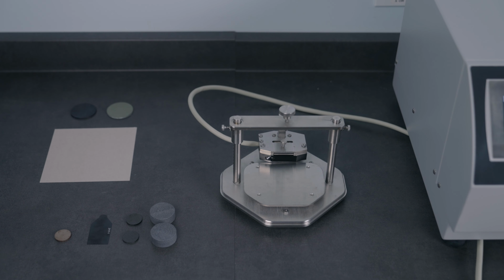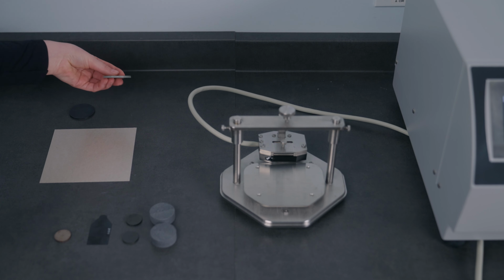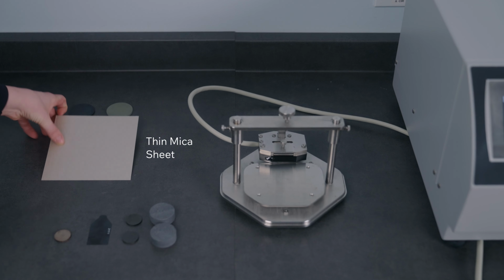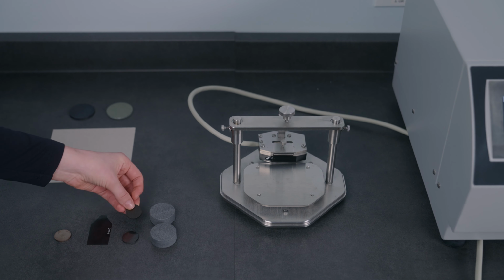So we'll just go through some basic setup of the TPS slab anisotropic module. So here we just have a few different samples that can be measured with the slab anisotropic module. We have an injection molded polymer, compressed fiberglass, and thin mica sheetboard. And today we're going to be testing Duratron for an anisotropic sample.